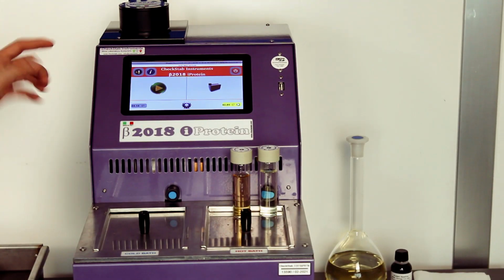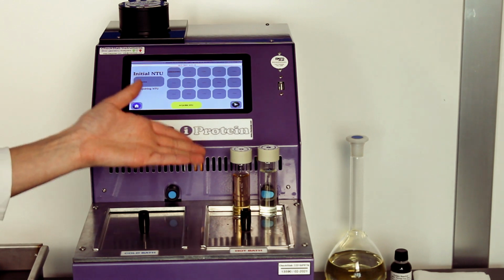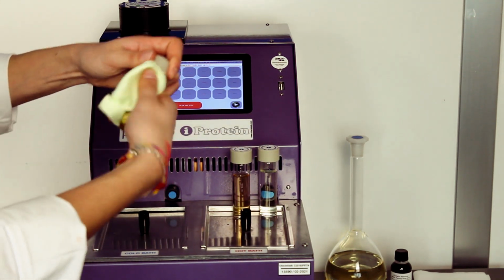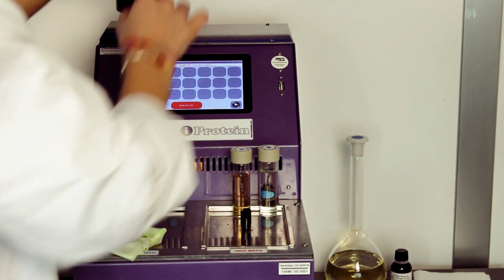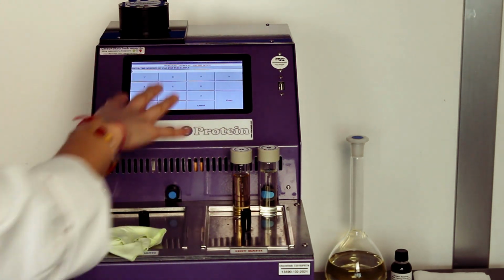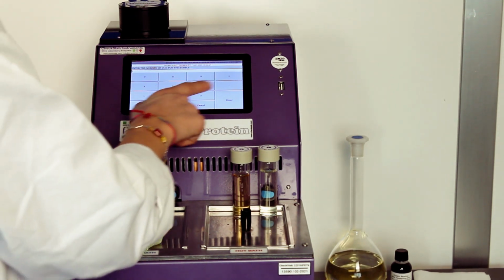Coming back to the home and pressing the green play, we can start our heat test. After filling our test tube, always paying attention to keeping the surface clean, we recommend the use of a microfiber cloth like this. We can proceed to the reading of the T1. iProtein now will ask us how we want to rename the sample and how many samples for the same wine we have to analyze. In this case, 1.